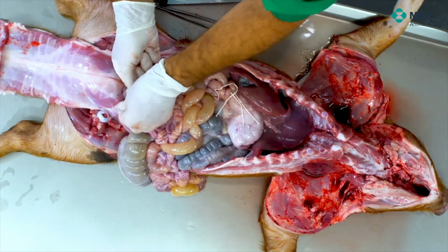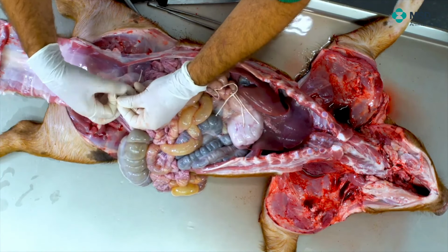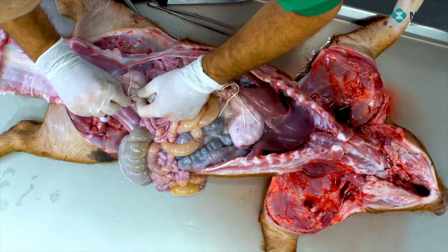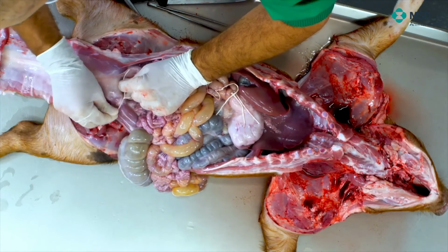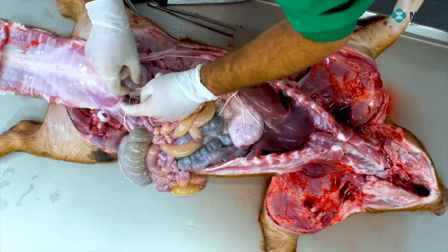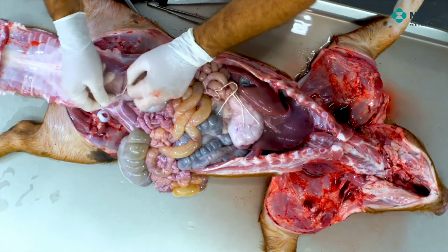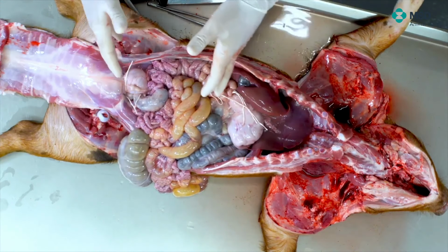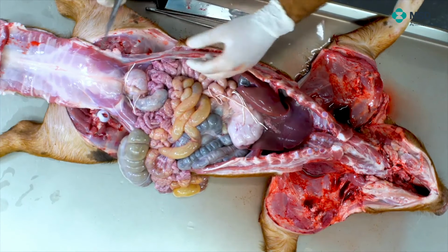This is one here, and the second one, which is being performed caudal. We try to do it 2-3 centimeters apart, at least, like that. It's a double knot in order to be sure that it will work. And now we are in the possibility of separating the whole intestine.